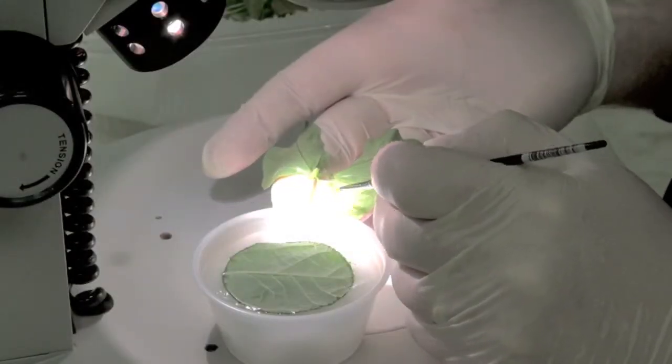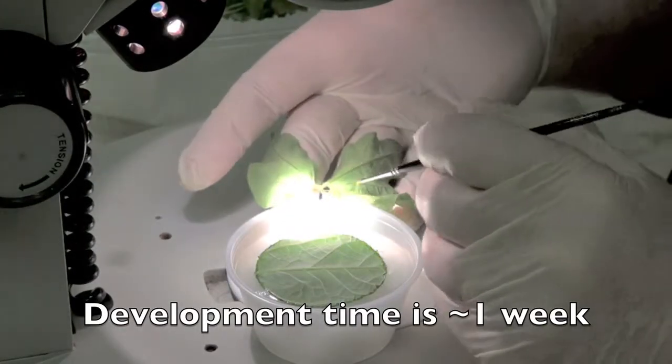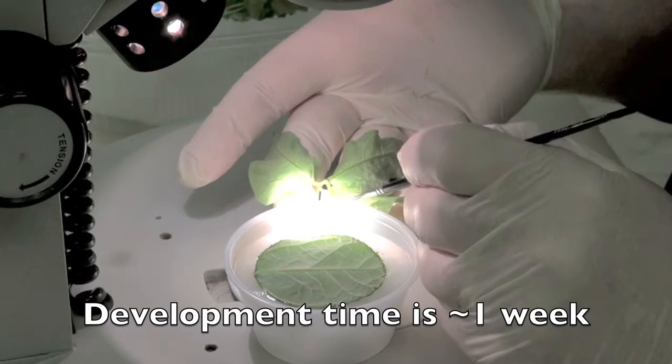At the beginning of the second week, this process is repeated. These eggs will give you the group of immature mites needed for the bioassays.